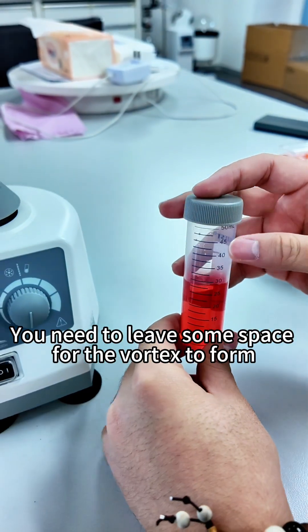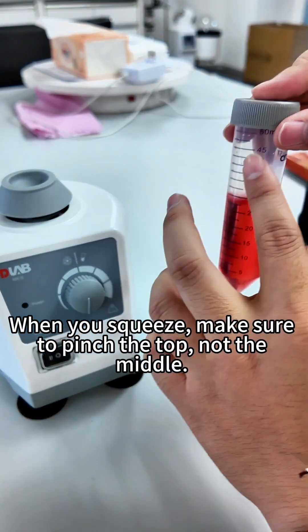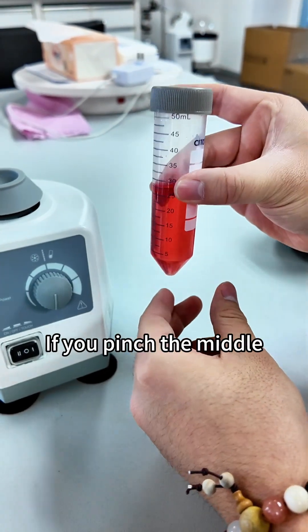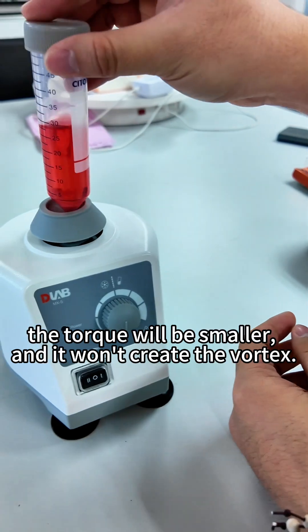You need to leave some space for the vortex to form. When you squeeze, make sure to pinch the top, not the middle. If you pinch the middle, the torque will be smaller, and it won't create the vortex.